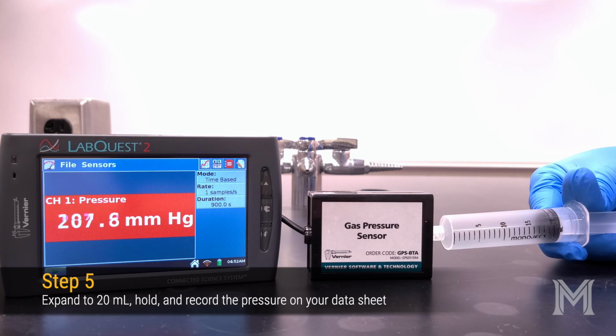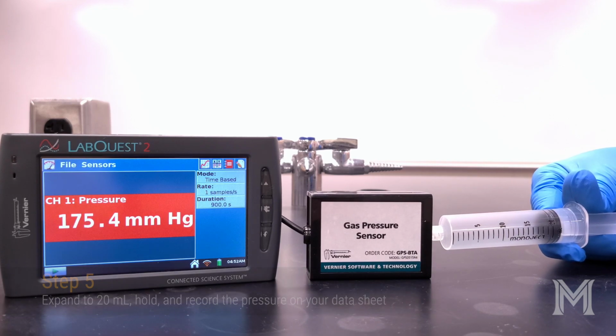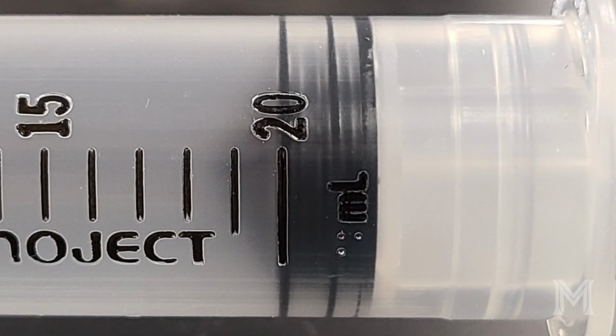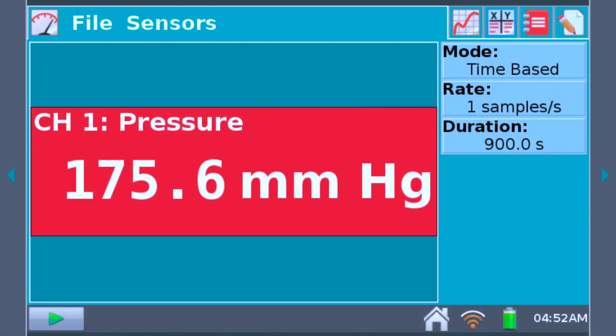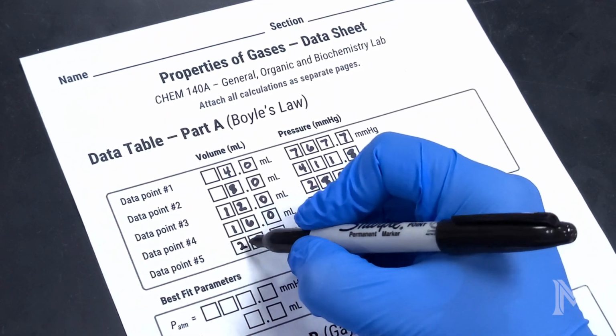Repeat the process one last time using a volume of 20 milliliters. Again, make sure that the leading edge of the plunger is lined up with the 20 milliliter mark. Once you've obtained your final pressure reading, record the value on your data sheet.